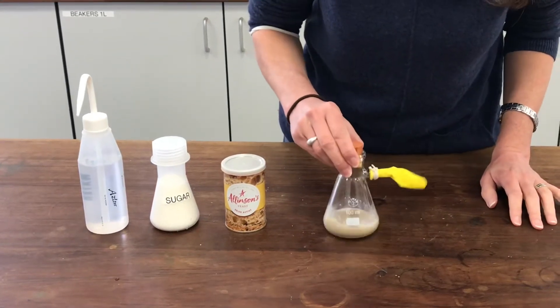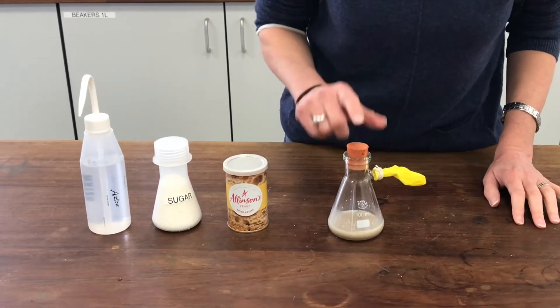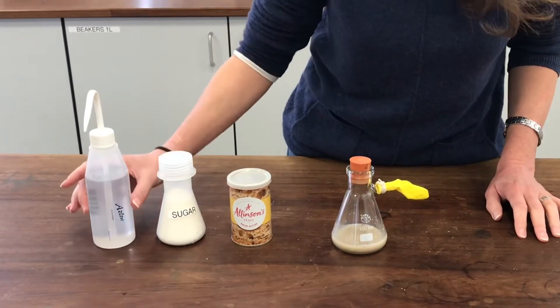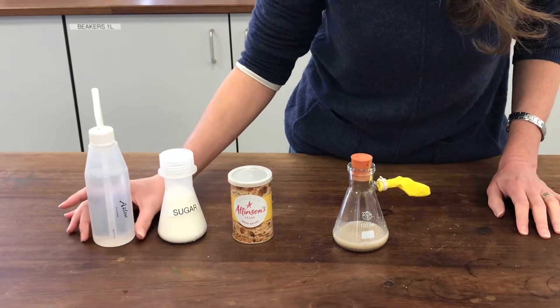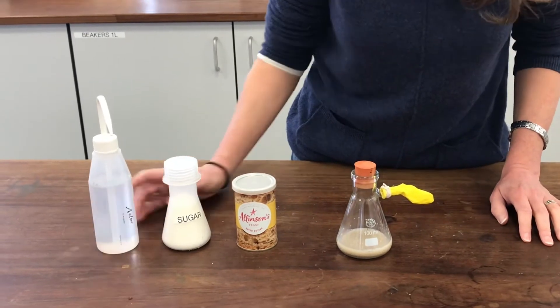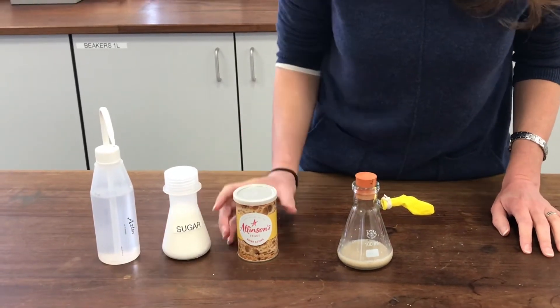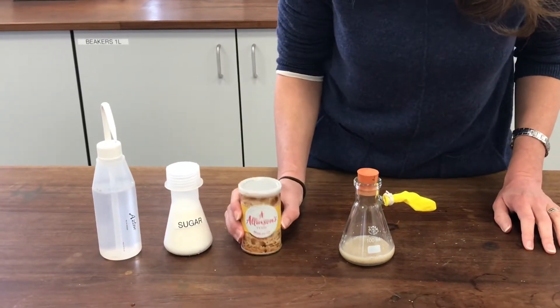This flask here has been set up to contain a mixture of three things. I've put some water in, I've dissolved some sugar in the water, and I've added a little bit of yeast.